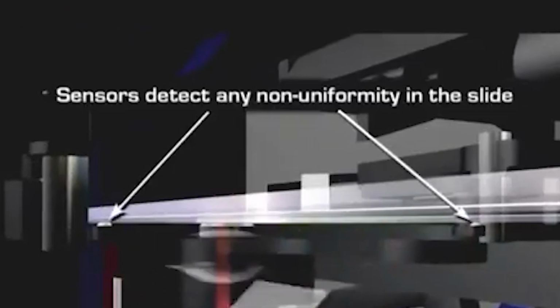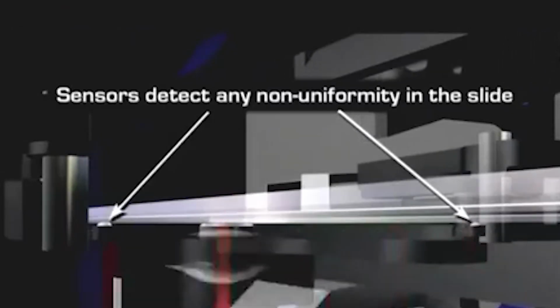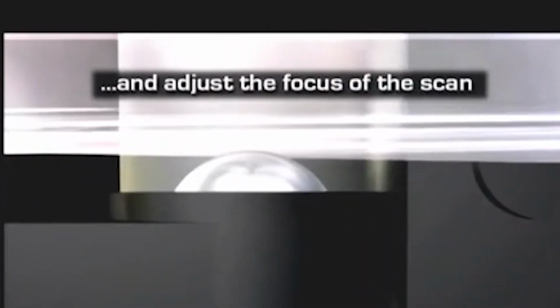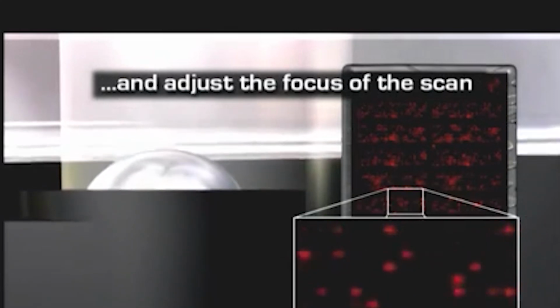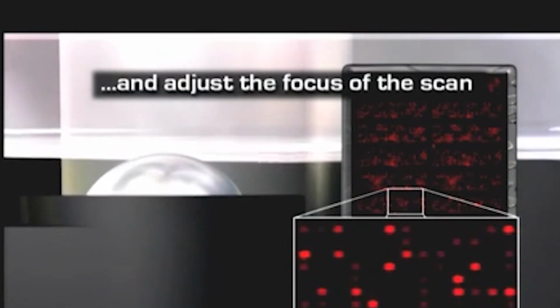The beam scans rapidly across the short axis of the slide as the robot arm moves the slide more slowly down the long axis. Fluorescent signal emitted from the sample is collected by a photomultiplier tube. As the scan proceeds, sensors detect any non-uniformity in the slide surface, and the robotic arm adjusts the slide position accordingly to ensure the array surface is always in perfect focus.